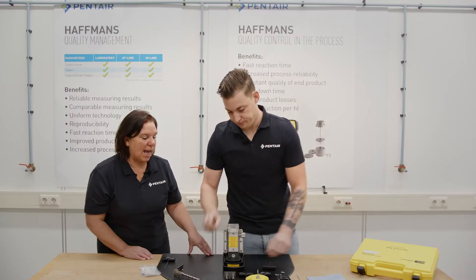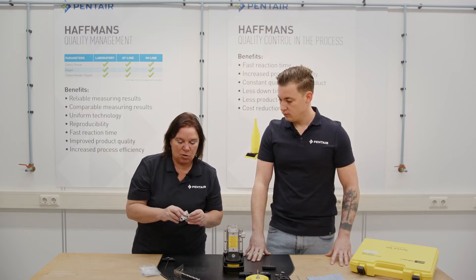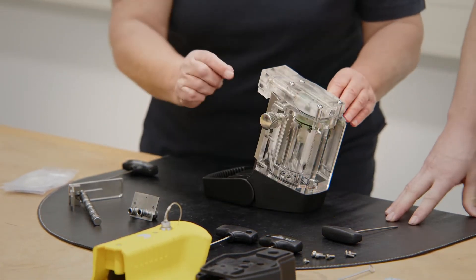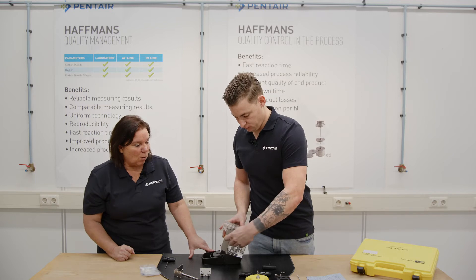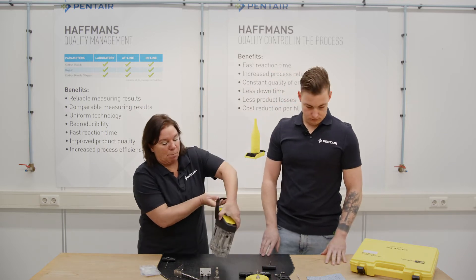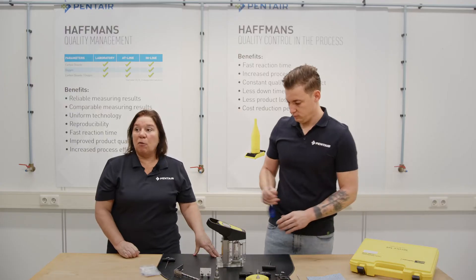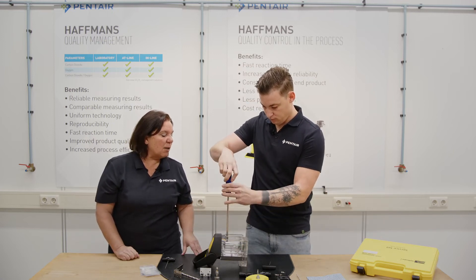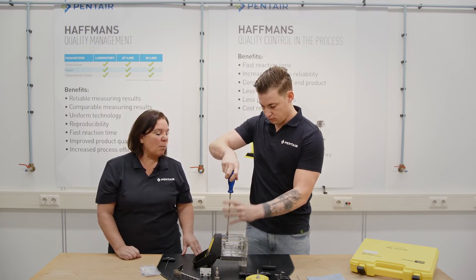Tim can remove the hose adapters by hand; I often need a plier, but take care that you do not damage the metal hose adapters. We then screw out the throttle valve — there is also one small o-ring there that must be maintained. And there is the black PVC screw in the housing that is the opening to use when you perform a pressure calibration. Use a big screwdriver that fits into the slot of this PVC screw so as not to damage it.